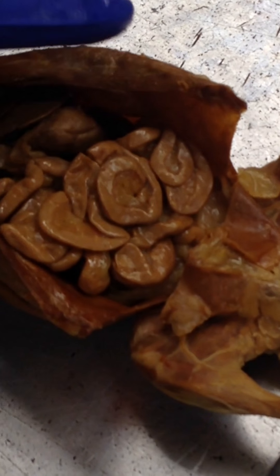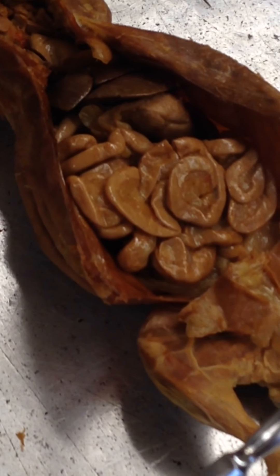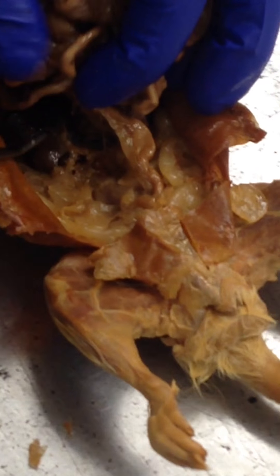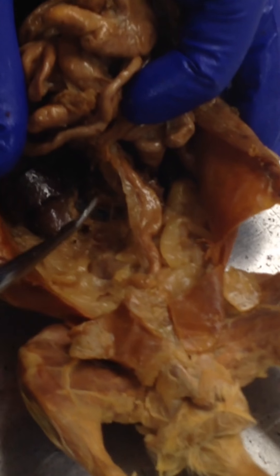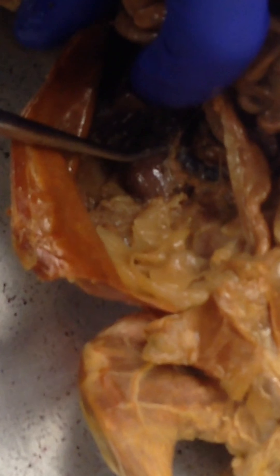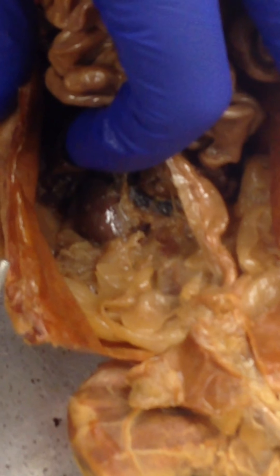And the suprarenal gland, also known as the adrenal gland, is attached to the kidney — it's the brown stuff under the fat. I think that's it.